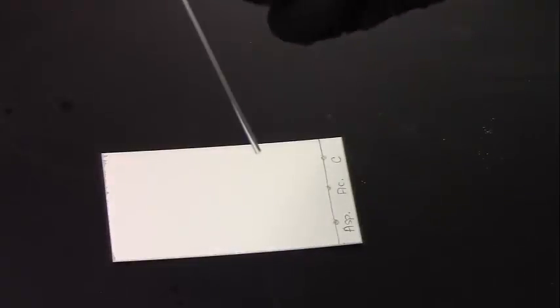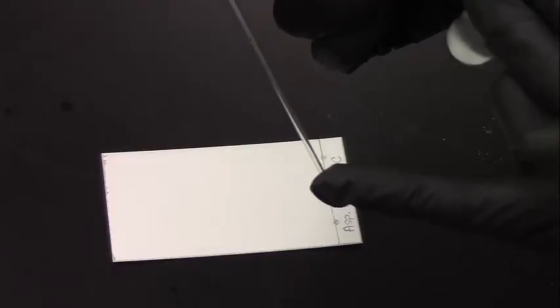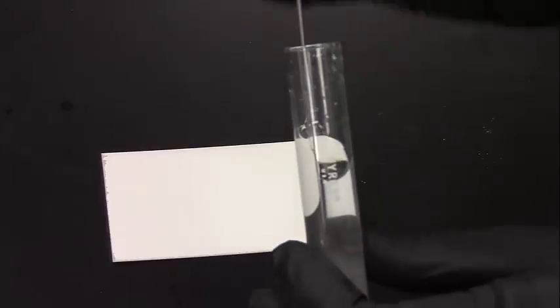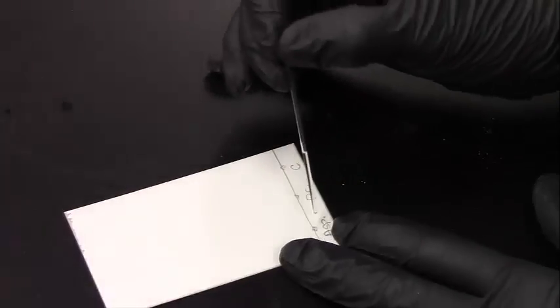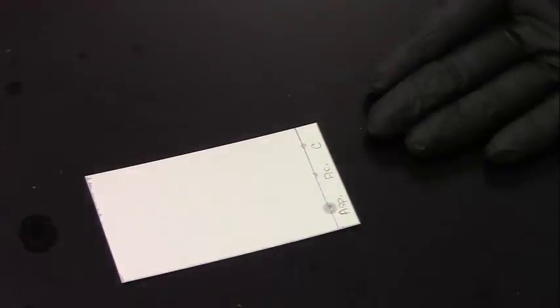and caffeine. In order to prepare your plate, you are going to use an open-ended capillary tube. This is just like your melting point capillary tubes, it's just open on both ends. You will stick it into your test tube that has the ethanol in your tablet, and you will spot. And in order to do that, you just dab the dot. You will repeat this using a new capillary tube for each substance that you have. And now you're going to wait for this to dry completely. Once this dries, you will no longer see the wetness, but you will be able to see where you spotted it.